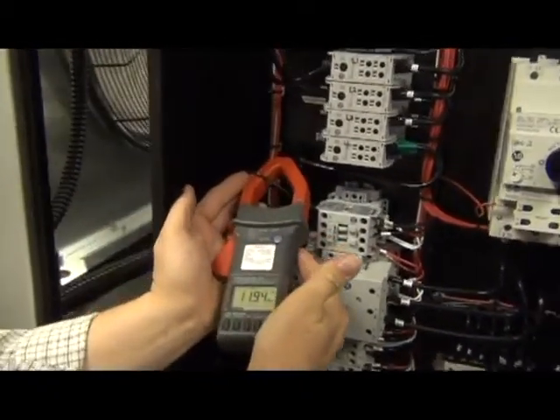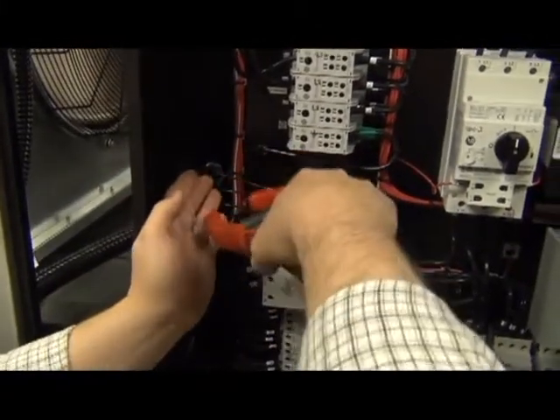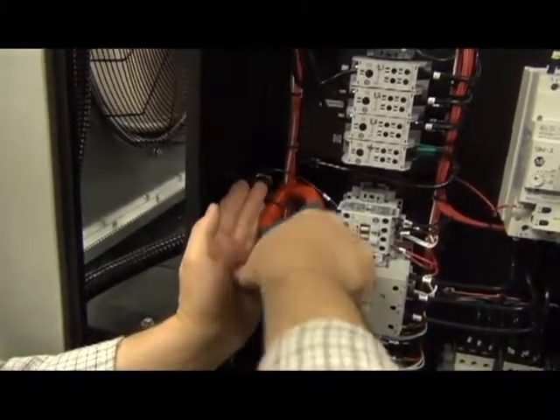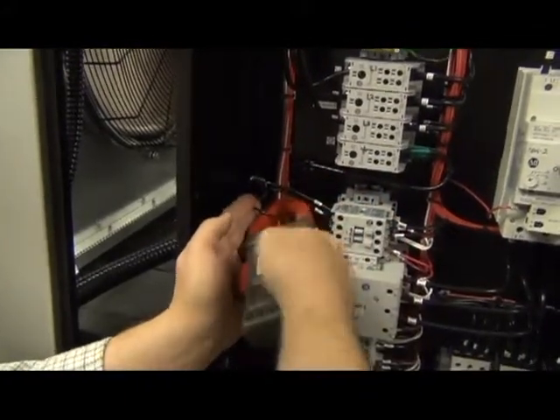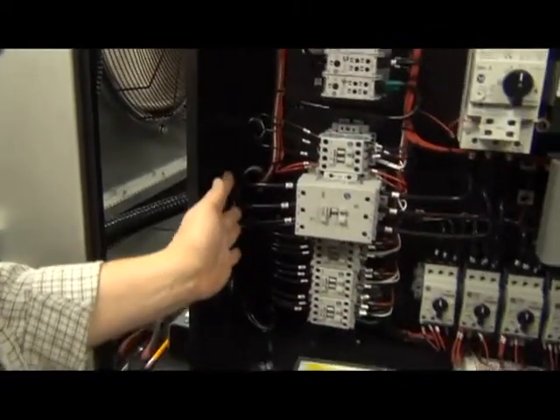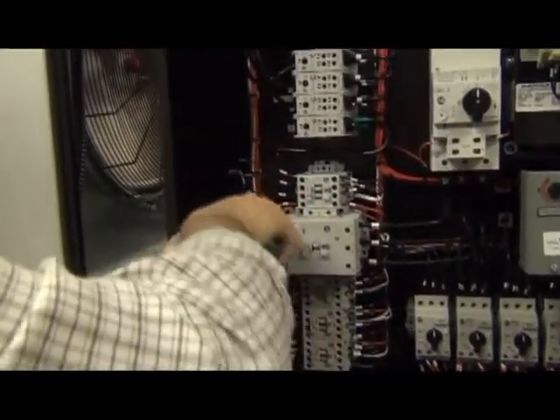Once the entire unit is up and running, you will want to check the amperages on each of the chiller components and make sure that they are operating within the acceptable range indicated on the chiller tag or in the manual. To do this, use your amp probe to read the amp draw on each individual lead and compare the reading to the tag on the back of the electrical box door.